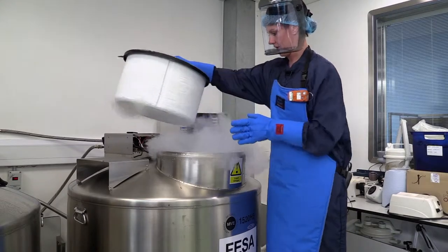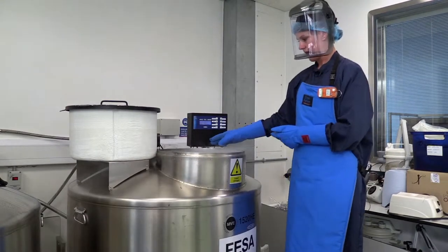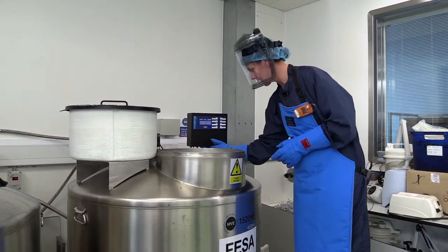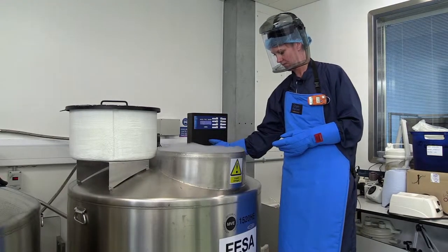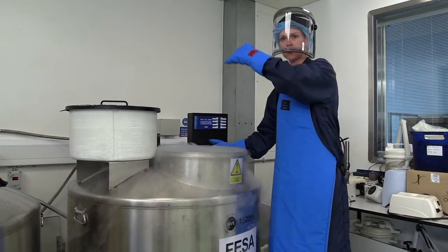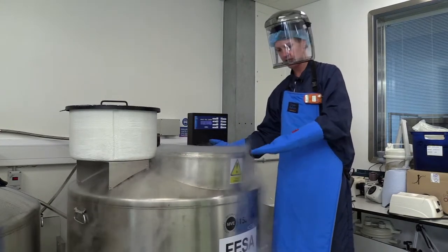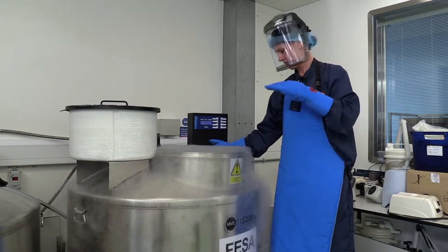Take the lid off. So this is just liquid nitrogen vapour that we've got on the top here. To find the samples in here we need to clear the vapour slightly. This is just liquid nitrogen being brought in from the tank outside, just to cool everything down — the temperature difference between the liquid nitrogen and the air is very big.